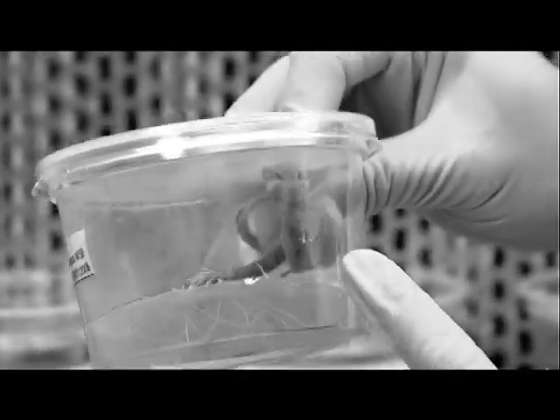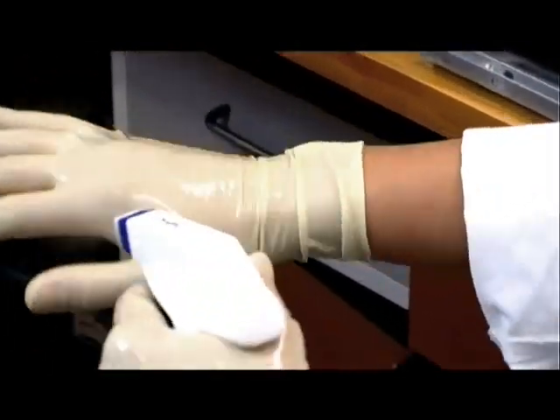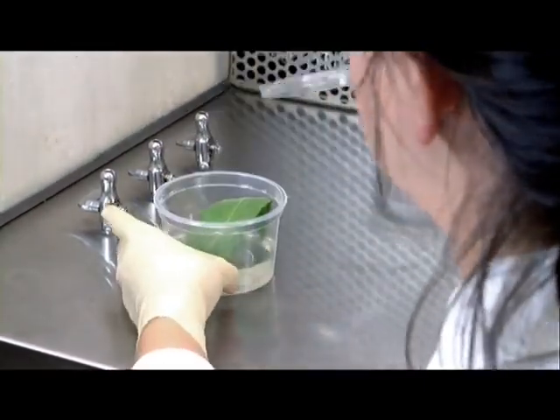Today we're going to look at tissue culture or micropropagation — the production of a plantlet or a clone, a genetically identical copy of its parent plant, via a process called the aseptic technique. Aseptic technique means that everything is kept as sterile as possible, having been treated with bleach or with alcohol, and then heat or pressure treated. We need to sterilise ourselves before we go into the flow hood. Taking some 70% ethanol and spraying it onto our hands ensures any surface contaminants won't be transferred to the plantlets inside the laminar flow hood, which is an air flow that prevents contaminants from travelling into the hood. We could choose any tissue type of a plant — shoots or roots, meristematic regions, or vegetative material like a leaf. The first thing that we need to do is surface sterilise our leaf to remove any microorganisms which might be on the leaf itself.